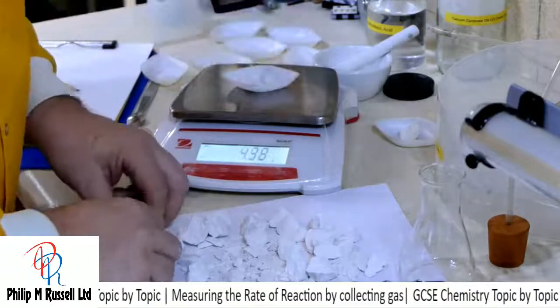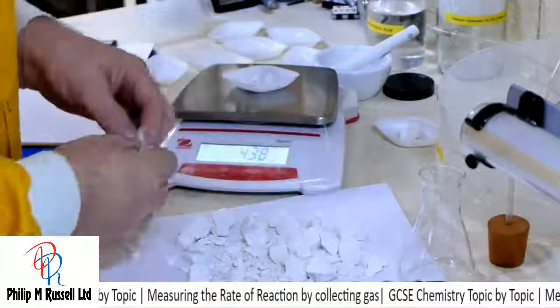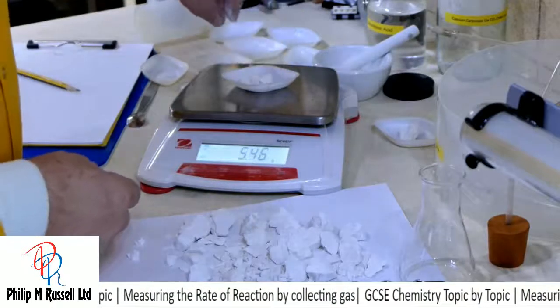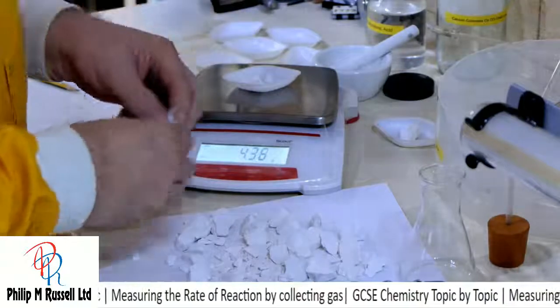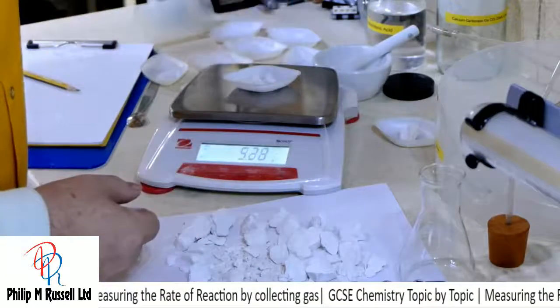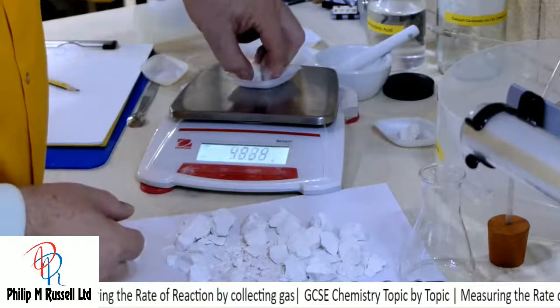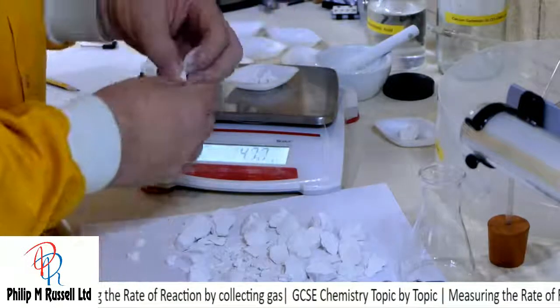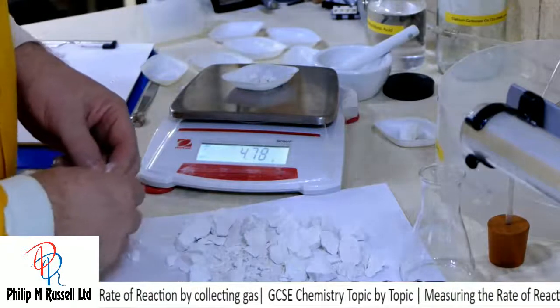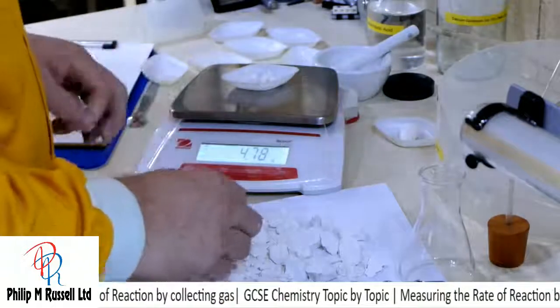Let's take a small piece out. Let's find a slightly larger small piece. That's 4.38. That's 5.4. That's too big. Let's see if I can break a bit off. 4.38. A bit heavy still. I've got a smaller piece here. That's 4.78. That's really going to be about as good as I'm going to get.